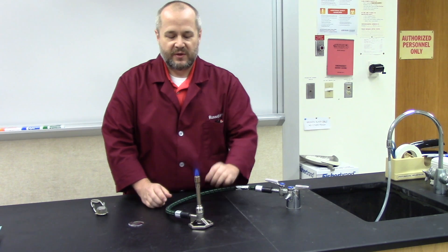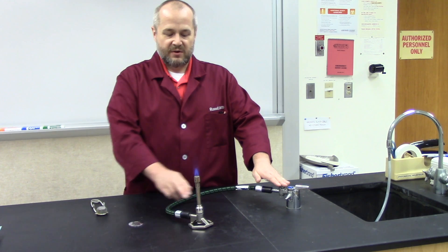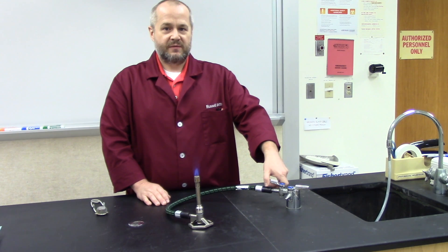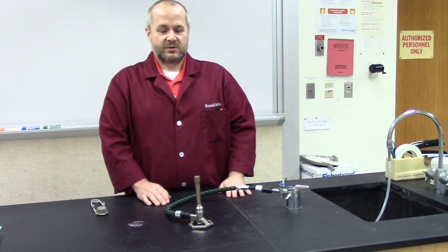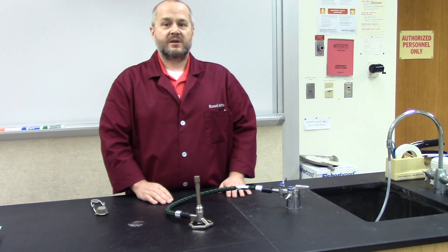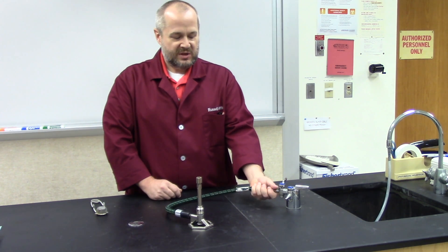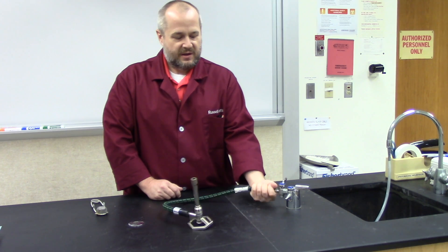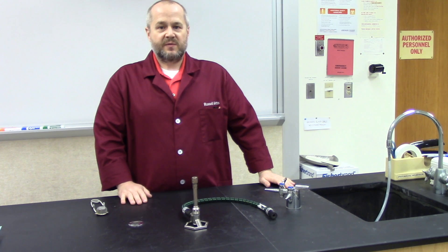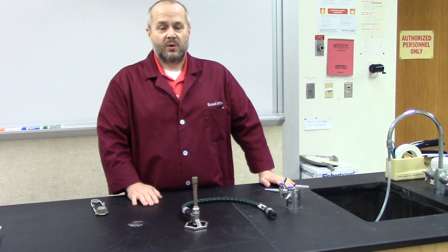When you're done with your Bunsen burner for the day, always turn the flame off from the source — the gas valve — never from the needle valve. To do that, turn the valve perpendicular to the hose and the flame extinguishes. The burner is now hot — don't touch it for at least 15 to 20 minutes. When you're ready to store it, pull the hose off the valve and the Bunsen burner is safe to put away. Make sure it's been at least 15 minutes to allow for cool down so you don't burn yourself or damage equipment.